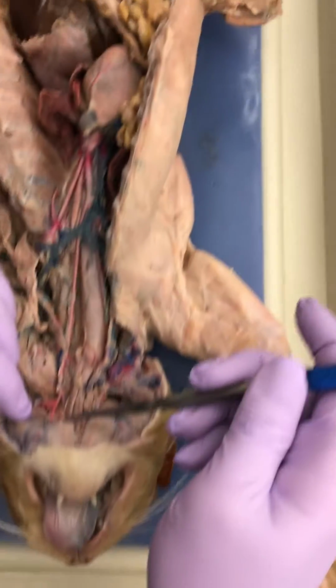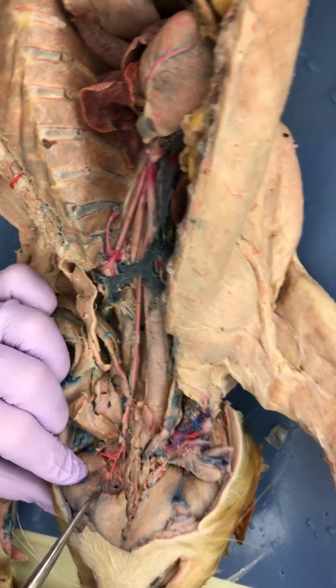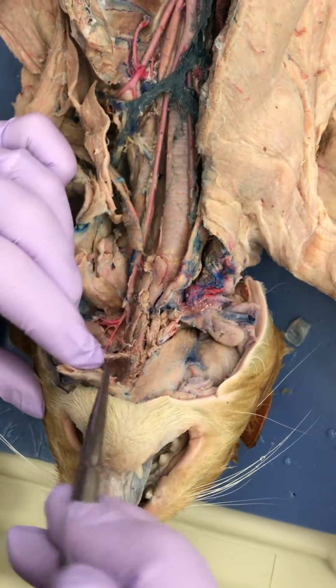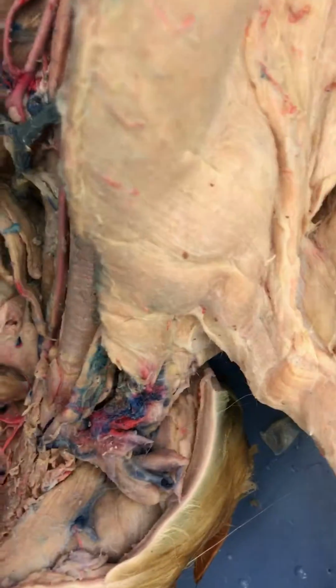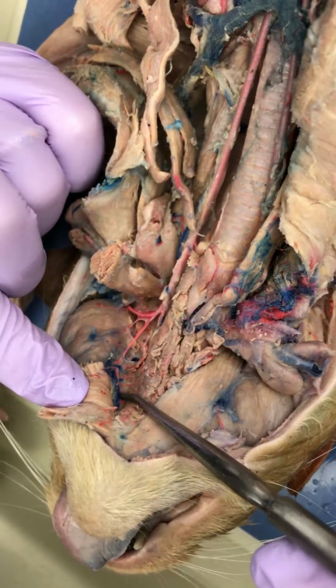Okay, then I don't know if you'll be able to see this view because I can't even see it, but I see a labial coming right here. Oh, okay. Yeah, you can see it. But I don't know. Let me push this back. Oh, yeah, submental. You got a good view there. So this one is the submental, the one going up. Yeah, you got a good one. Submental.